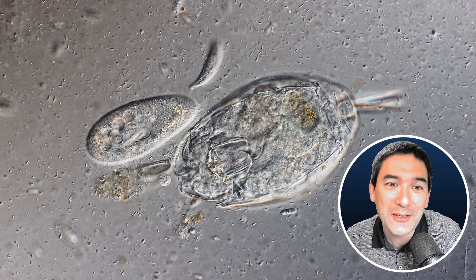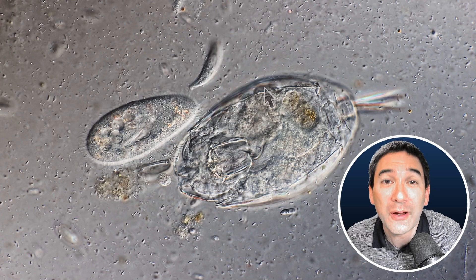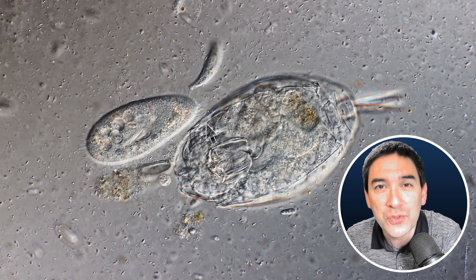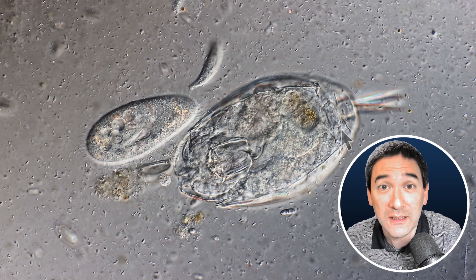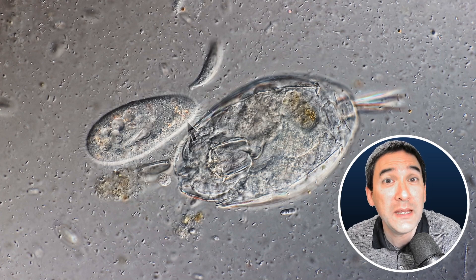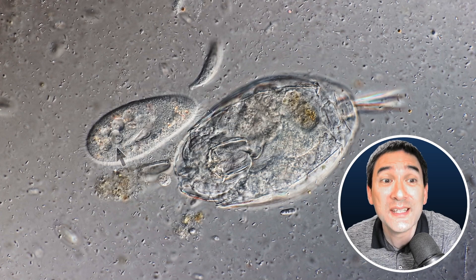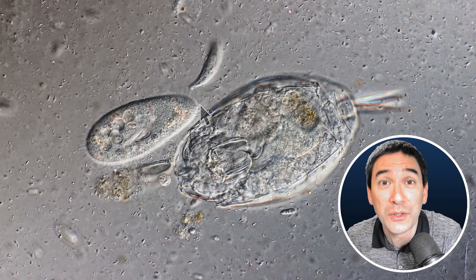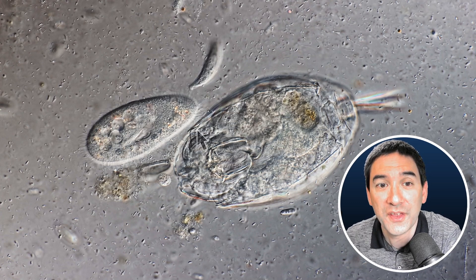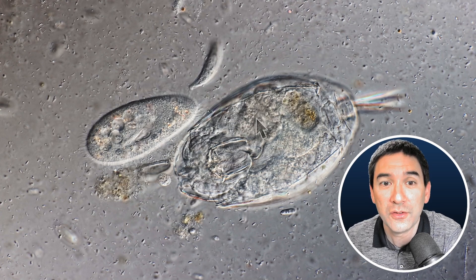This here in the center is a rotifer. It is a multicellular animal made of approximately 1,000 separate cells. Over here on the left of it we have a paramecium. It is a protozoan — a single-celled organism, one cell. Just imagine this: a thousand cells over here, one cell over here.